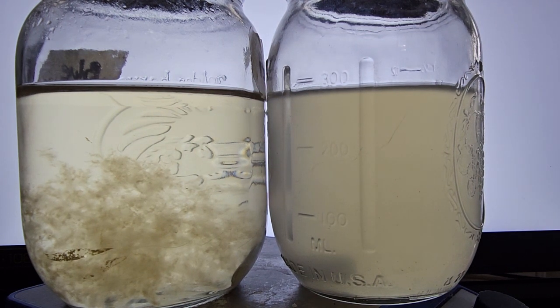So a lot of people will tell you, make the liquid culture, cook it for 30 minutes in your pressure cooker at 15 PSI. And I was doing that for a long time. What I kind of started realizing is you don't have to cook things that long. Once the liquid culture is boiling, whatever's in there is going to die. So what I do now, I actually have brought that time down to 20 minutes, and you could either go down a little bit further, I think, as well.